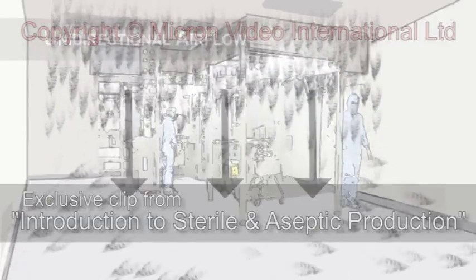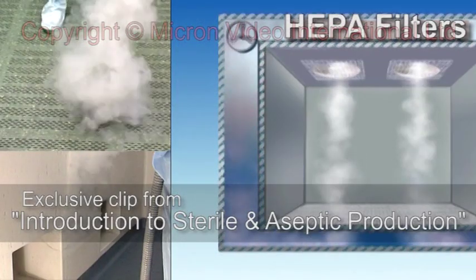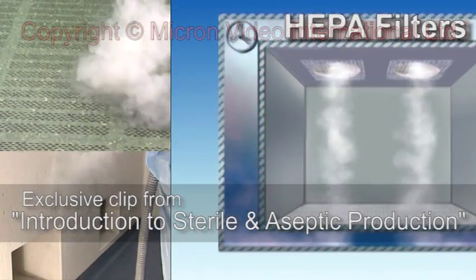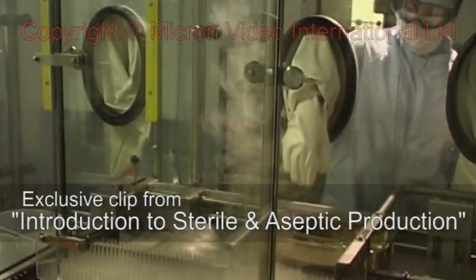The uniform streams of air collect particles and transport them out of the clean room through grills and ducts. The air is then filtered and recirculated.